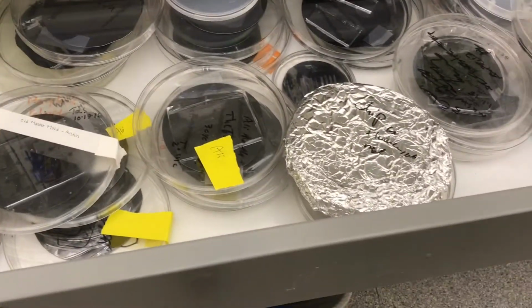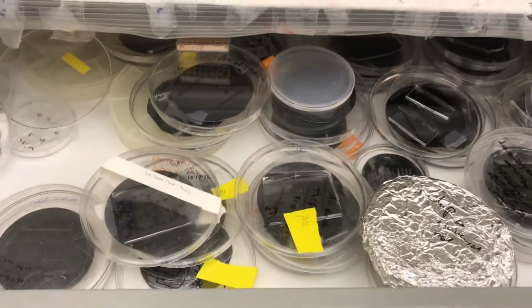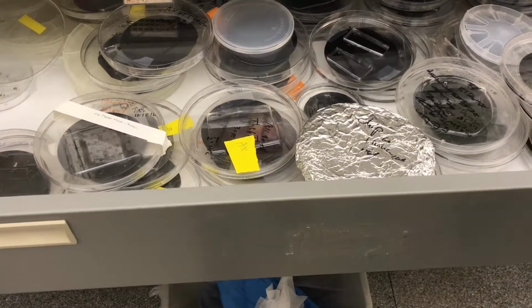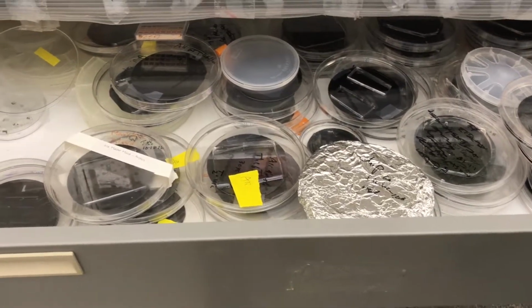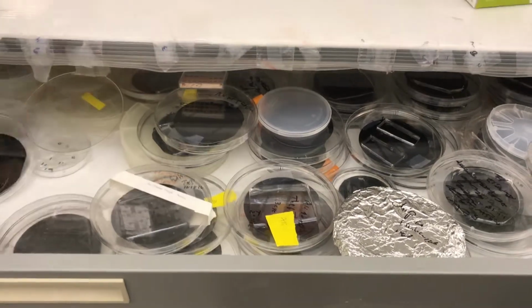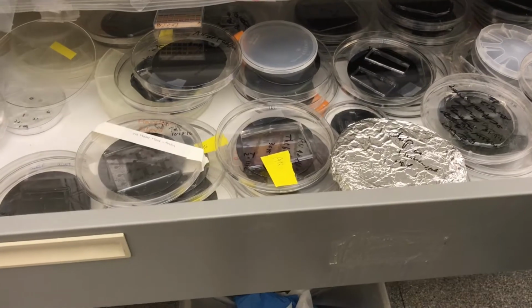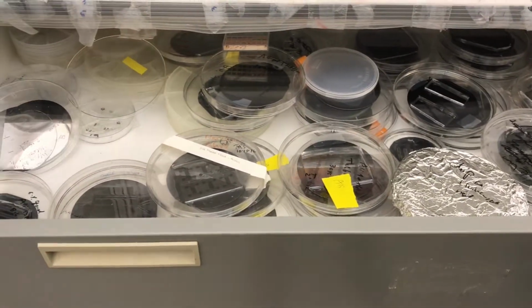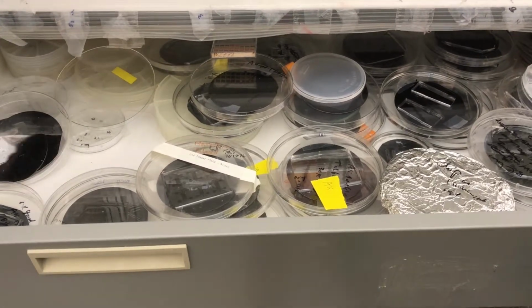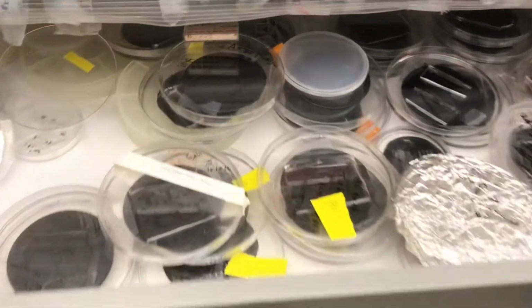So many photo masks are there. Why are you not using them? Are they all bad? None of them is working, but normally we don't throw out anything. We just keep them for learning. We show trainees, this is the problem with the photo mask, it should not be like this in the master mold, it should be in this way. This is the fault in the master mold preparation.